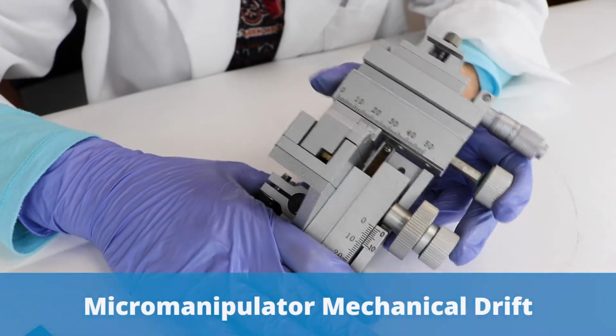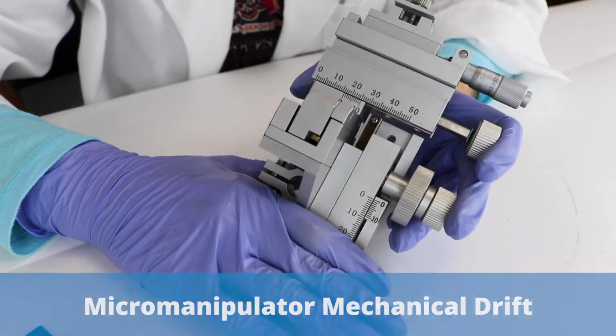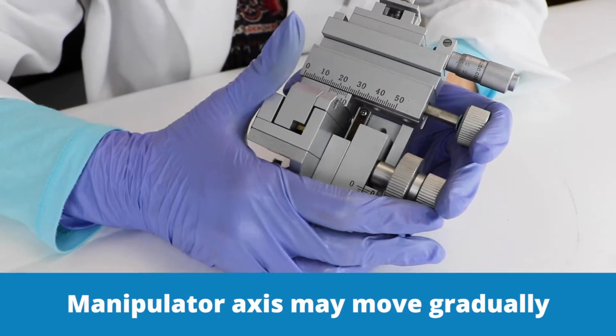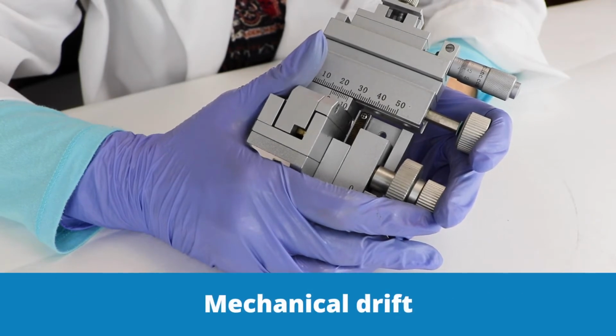Today we're going to talk about mechanical drift on a micromanipulator and how to correct that. This is the popular version. This is a KITE. This manipulator axis may begin to move gradually under its own weight, even if it's not being touched. This is called mechanical drift, and it happens from normal use of the manipulator over time.